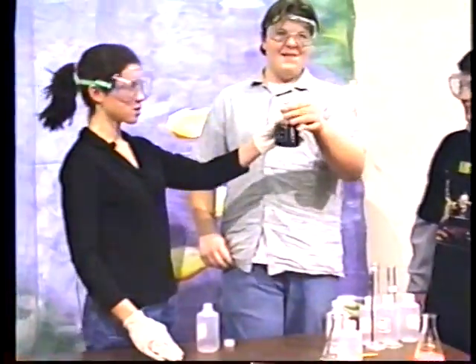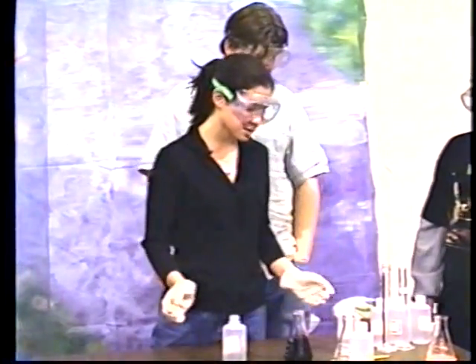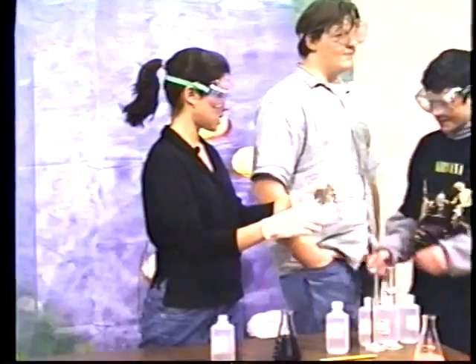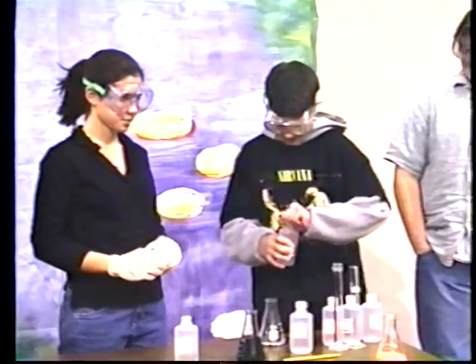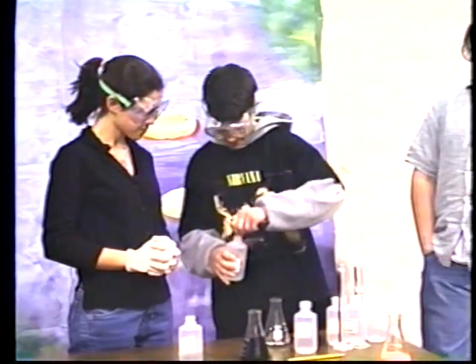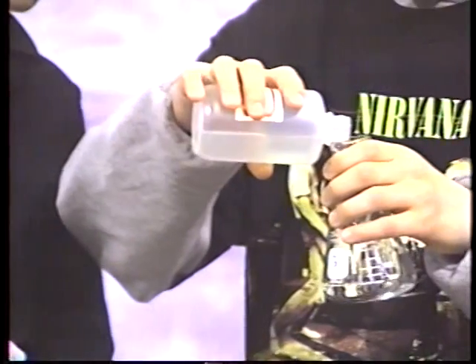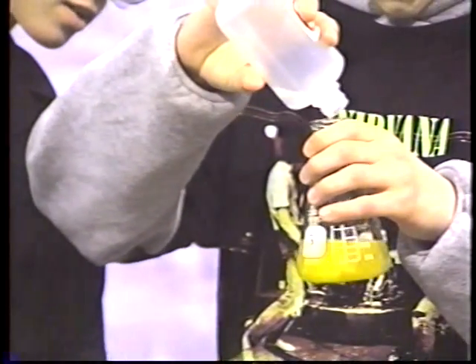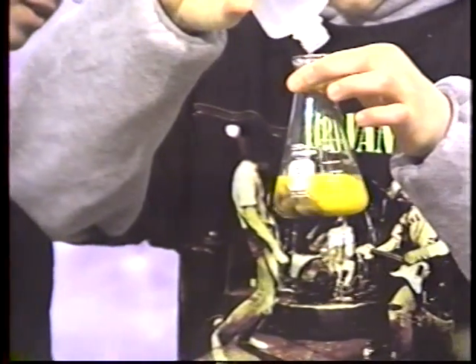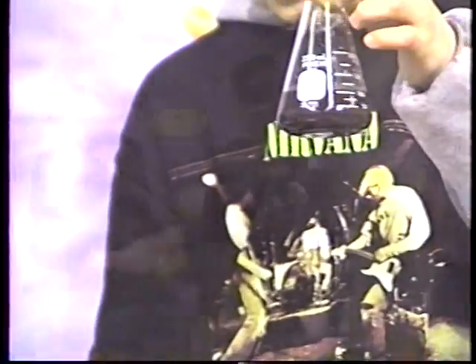What did you do wrong? Well, as you can see, he didn't do it as well as I did. So, there's somebody else who thinks they can try it. Here you go, Doug. Make sure you hold it so everybody can see. Shake it around. Ooh, you got the orange too. Wait a minute. Now, how did that happen?